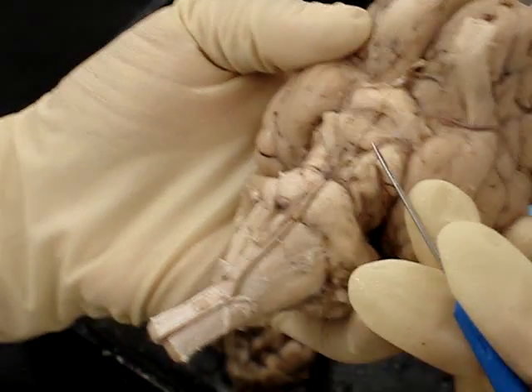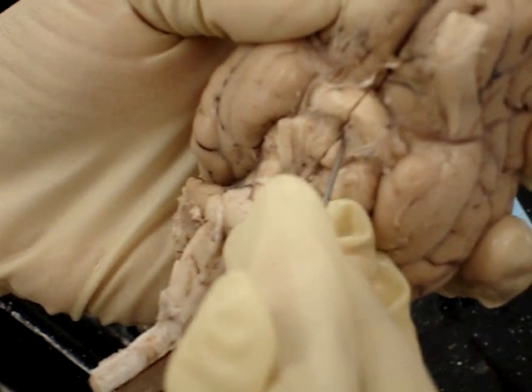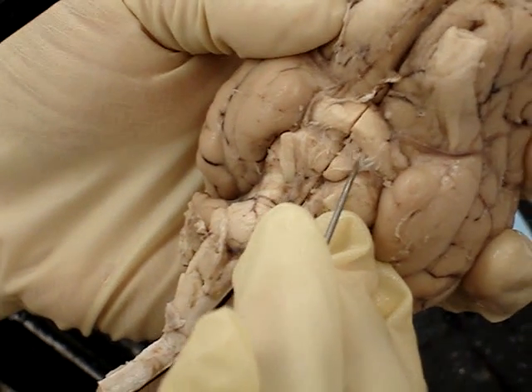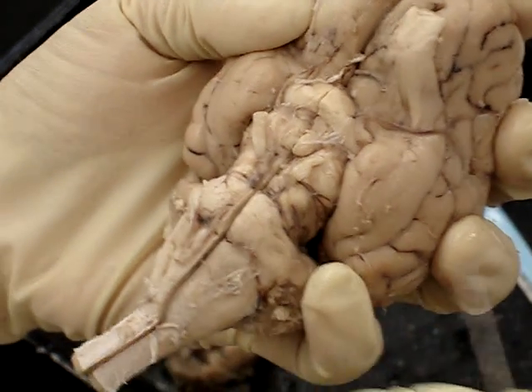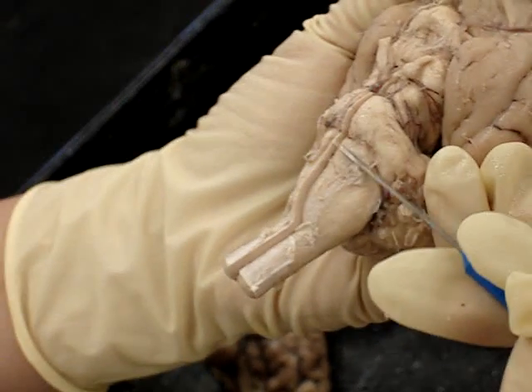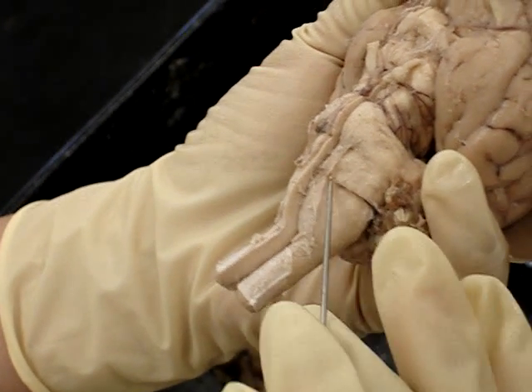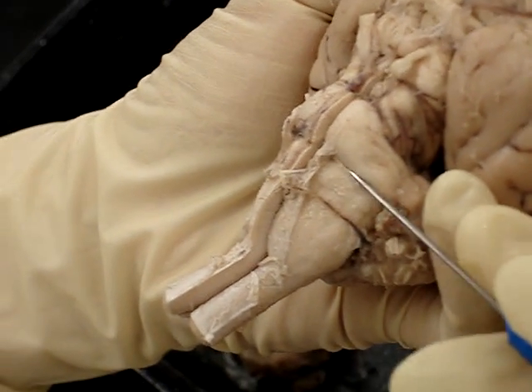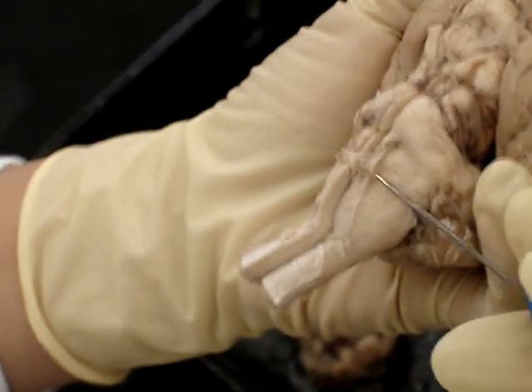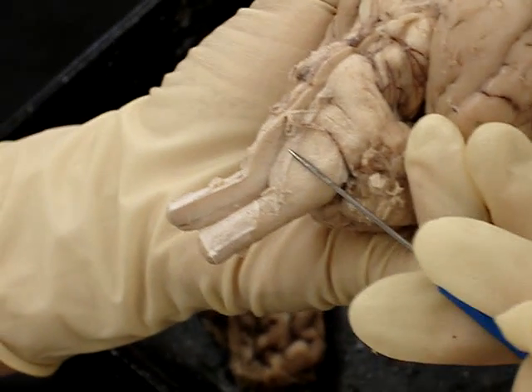The tuber cinereum — so there's the optic chiasm, the infundibulum is in the middle, and right next to it, this mushy area here, is the tuber cinereum. The trapezoid body is right below the pons. If you move it, you can see there's a little line between the pons and the next part, which is the medulla oblongata. So: pons, trapezoid body, medulla oblongata.